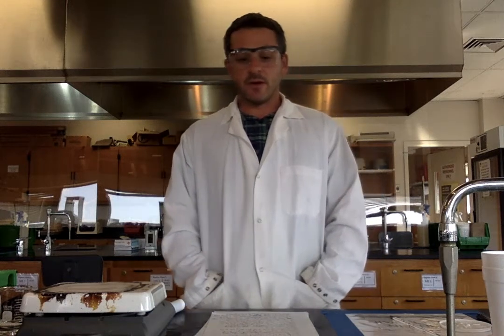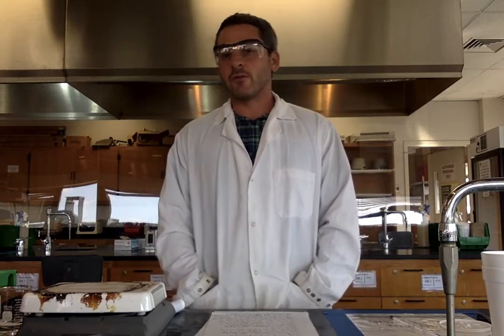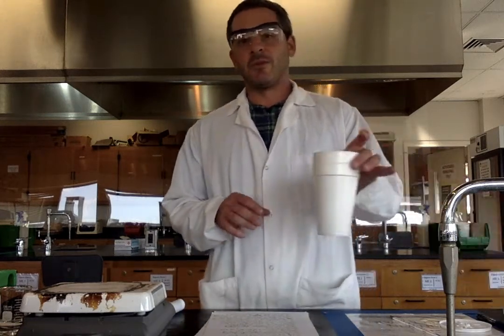Chemical and physical changes in chemistry often involve changes in energy, and heat, a form of energy, is often released or absorbed during one of these changes. The heat will always flow from the object of a higher temperature to the object with a lower temperature. The heat flow is going to be measured by a calorimeter.